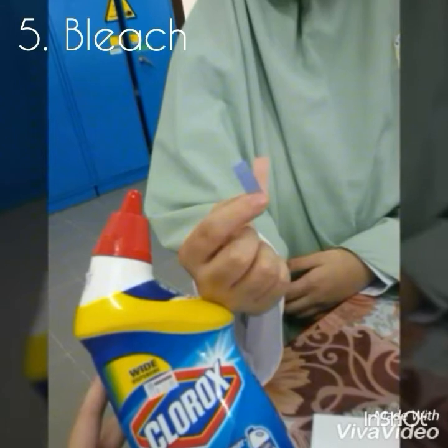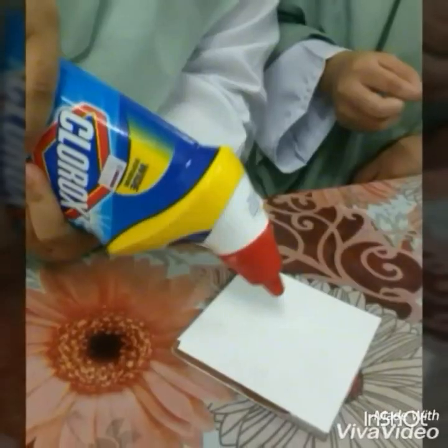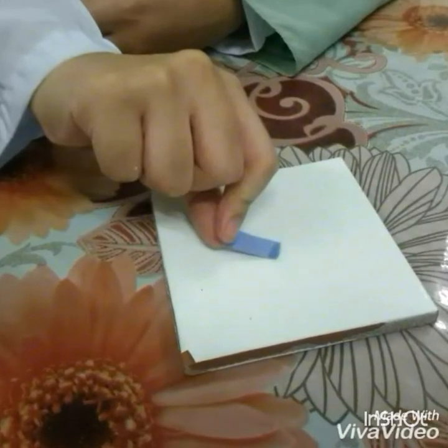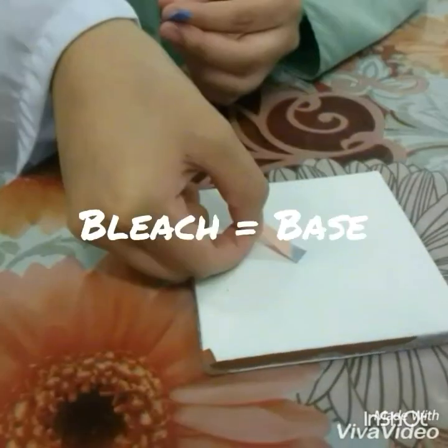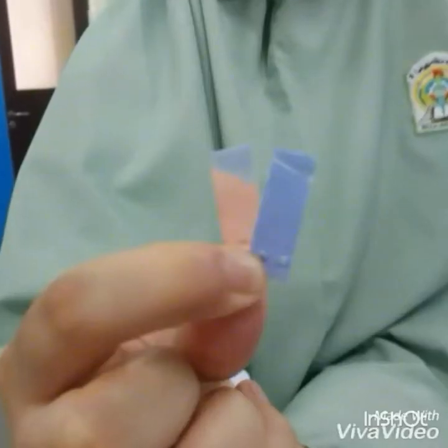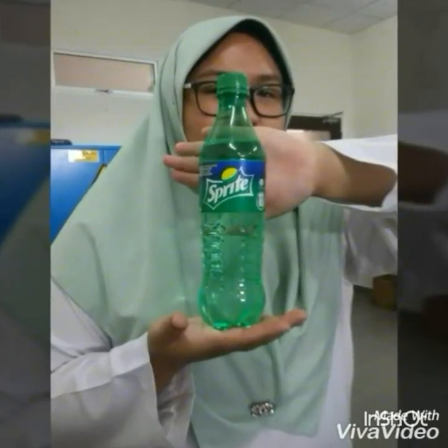As the fifth sample, we tested bleach, following the same procedure as the other samples, but the result was different. Bleach is a base because the bleach changes the red litmus paper to blue color, and the blue remains the same. Last sample we're going to test is Sprite.